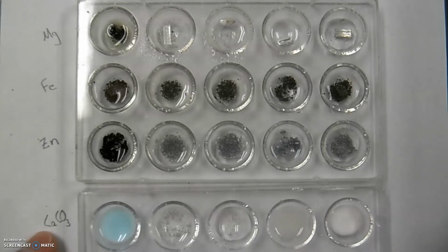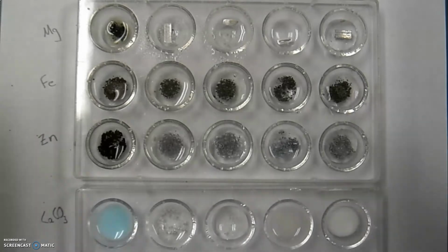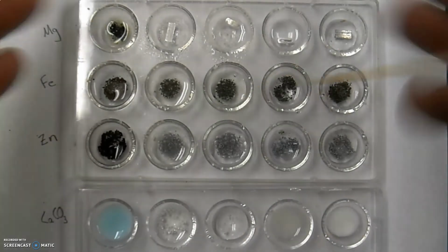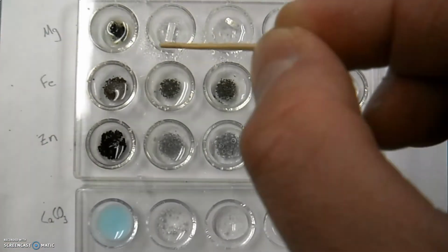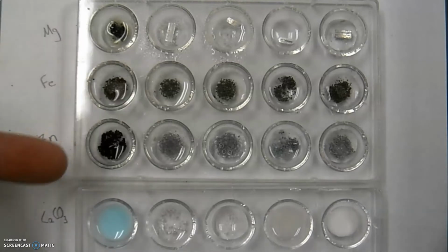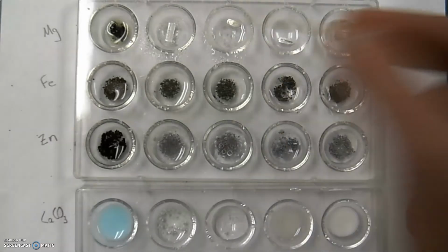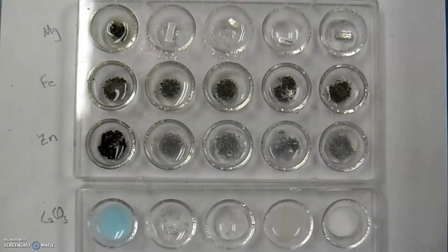Okay, so I've laid those out as far as reactions, non-reactions, and then eventually I'll come back over and show you on the board what I would be looking for. So on your sheet, what you should be doing is putting out something that looks similar to this table here, and then putting in a reaction and what's your evidence. So bubbles, changing color, something along those lines, or dissolving, or you would just say NR, which indicates no reaction.